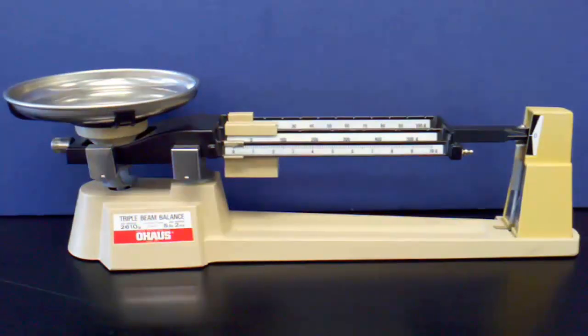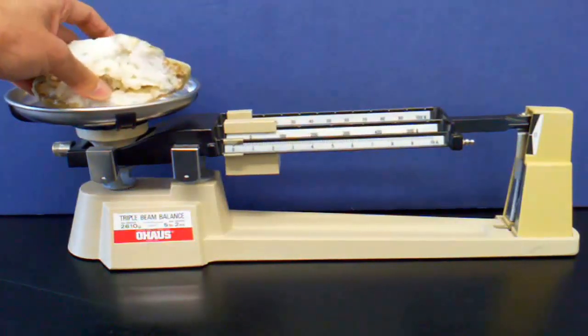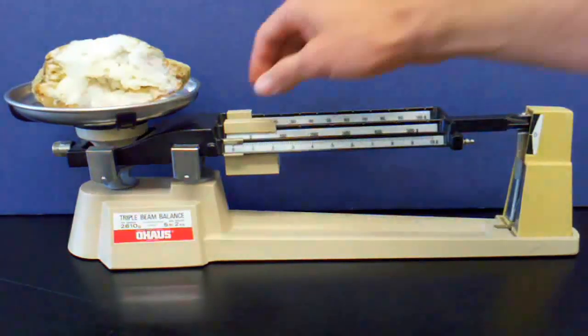Once the balance is indicating zero, I'm ready to begin. I place the object to measure the mass in the pan of the balance.